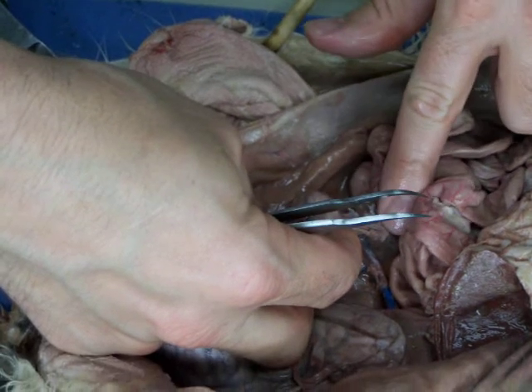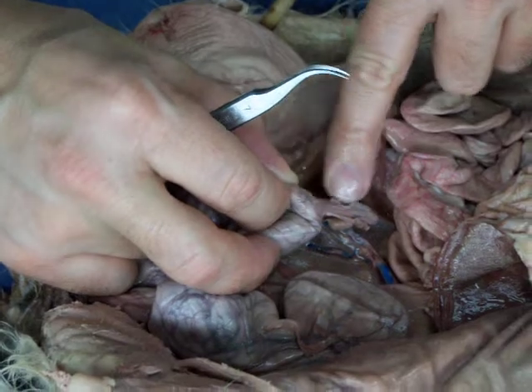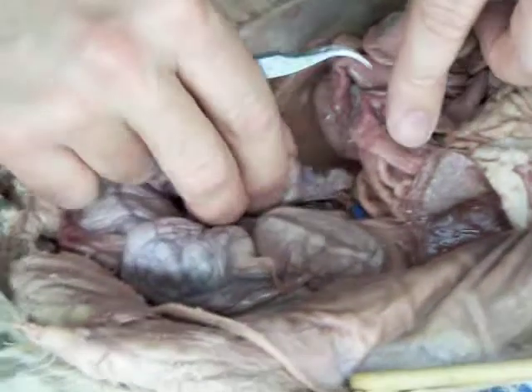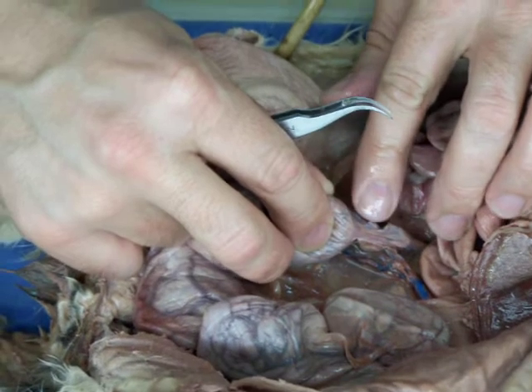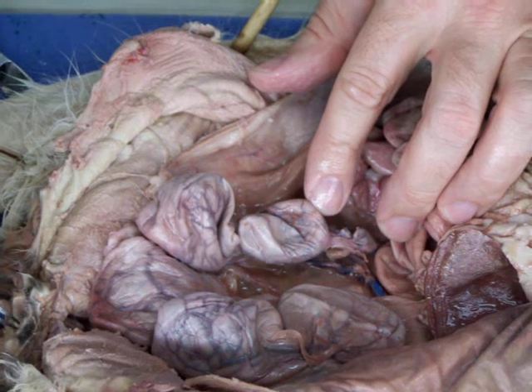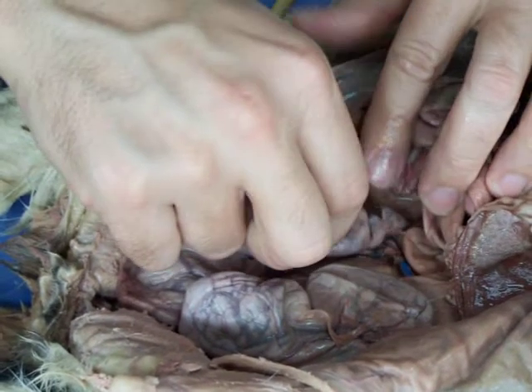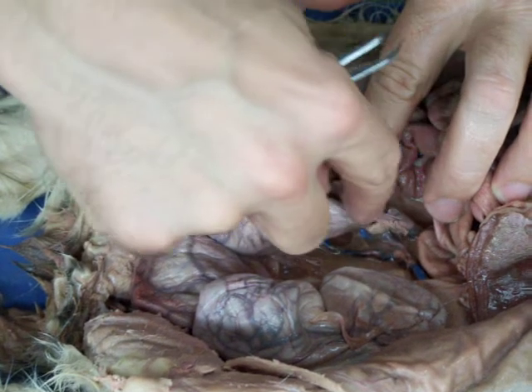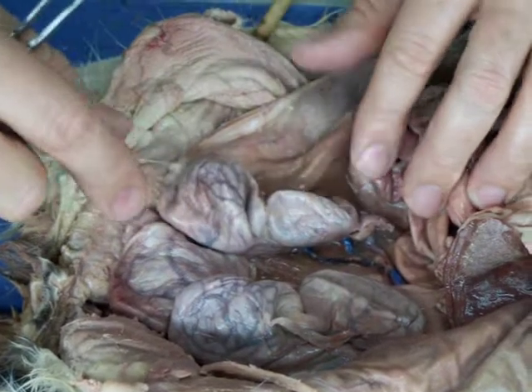See the little coiled tube in here? See this tube running right through the mesentery? And that tube dumps into the uterus, and usually, like in humans, somewhere down that tube is where fertilization occurs. So the sperm are inserted into the vagina, they travel up through the cervix into the uterus, and then they pass up the uterus to that uterine tube. Fertilization occurs there, and then the fertilized egg, the zygote, travels down and implants in the uterus where these have implanted.